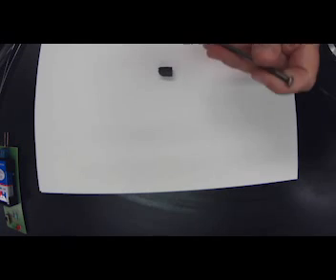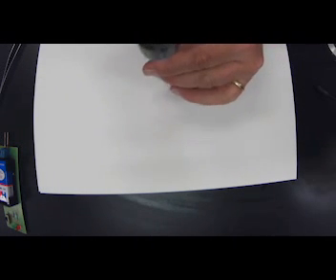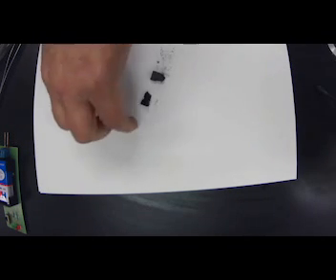Okay. And let's see if it's malleable, which means when I hit it with a nail, it should not be brittle. It should not break apart. Let's see what happens if it's a metallic bond. And again, as soon as I tap, it breaks apart. Okay. So result of tapping, it's brittle.